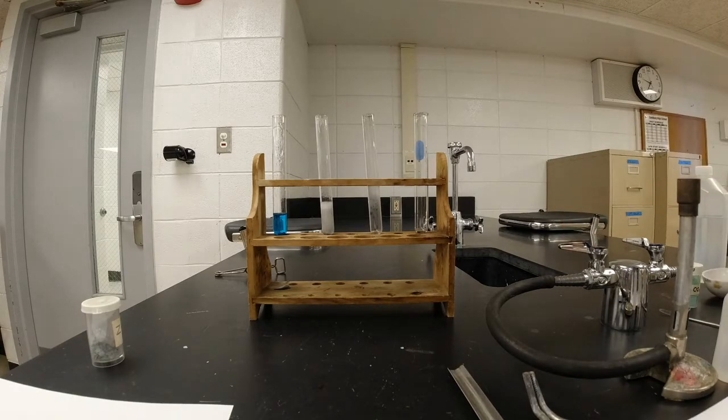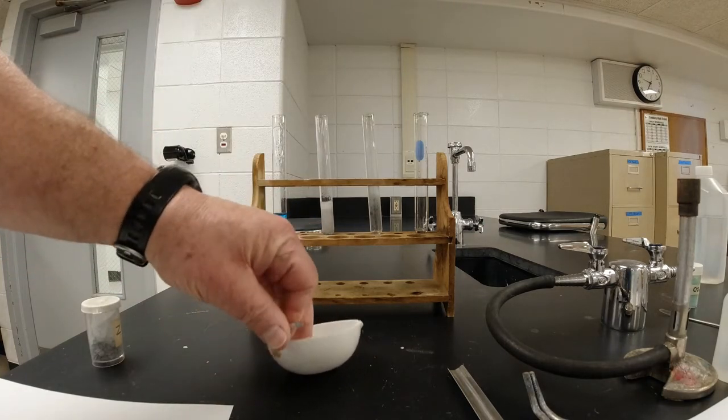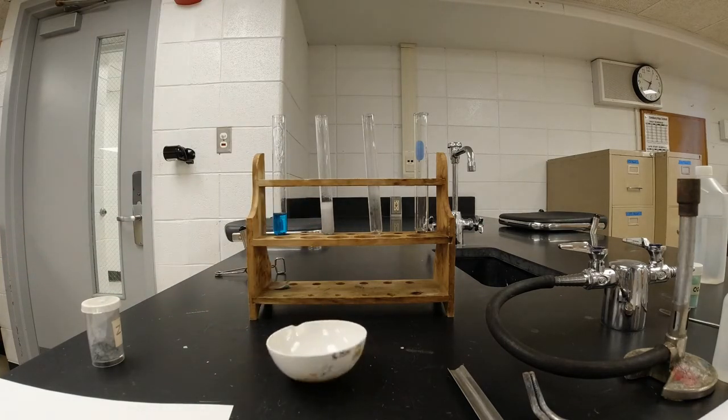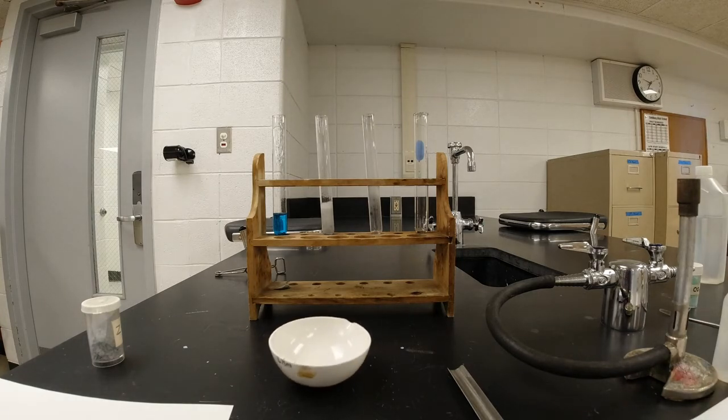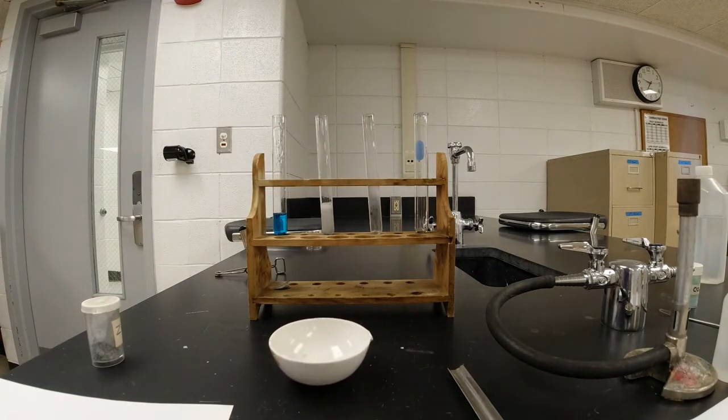All right, I'm going to need a couple things here for the next part. So I need to look and see. All right, in number 3, I'm going to take the crucible tongs. These are called crucible tongs, and it's because of this little diamond shape in here. What I'm going to do is take a piece of copper wire.